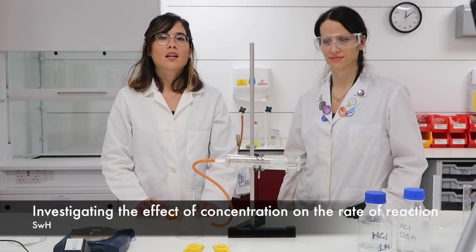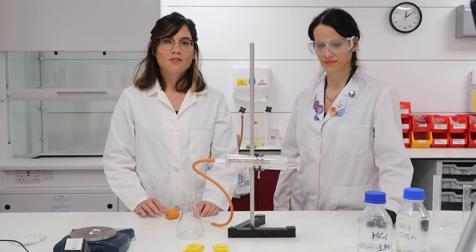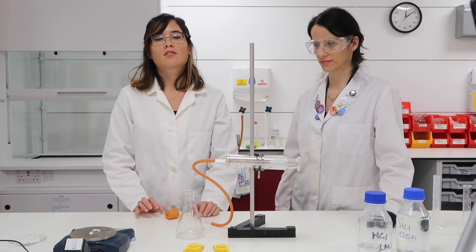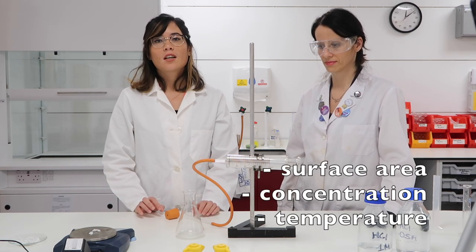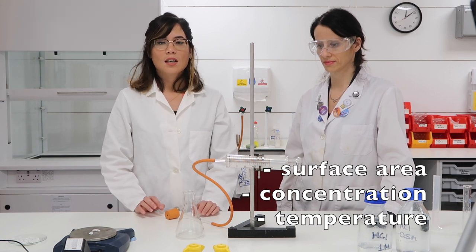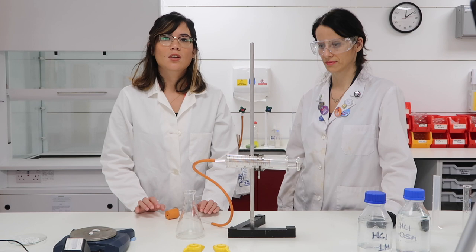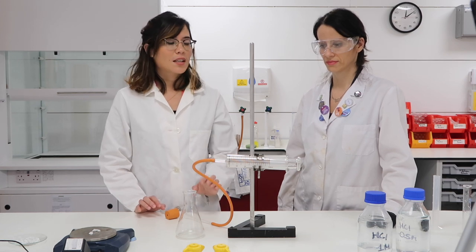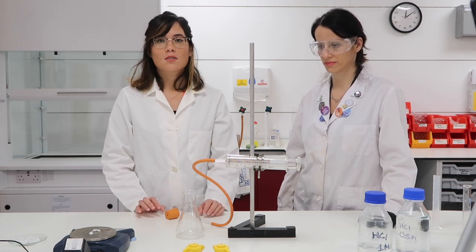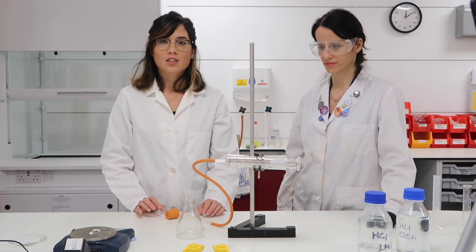In today's video Emilia and I are going to be looking at the factors which affect the rate of reaction. Now there are three things which affect the rate of reaction: surface area, concentration of solution, and temperature. In today's video we're going to be looking at concentration of solution — in particular how we can change the concentration of hydrochloric acid and how that will alter the rate of reaction.